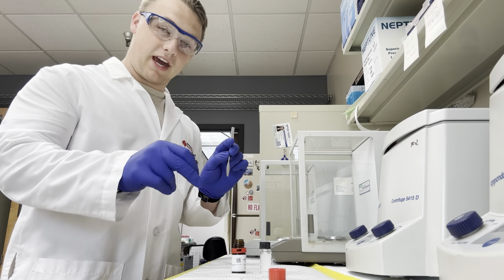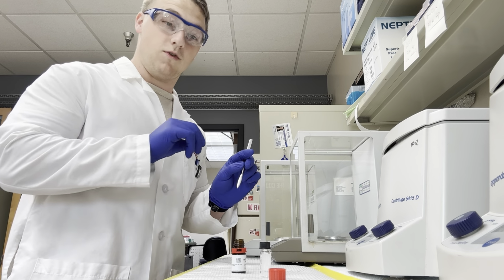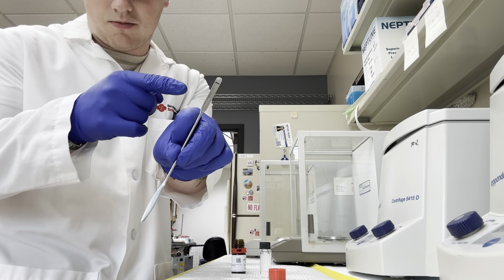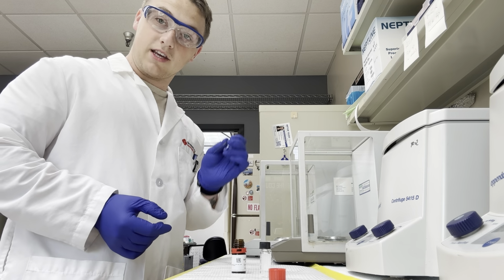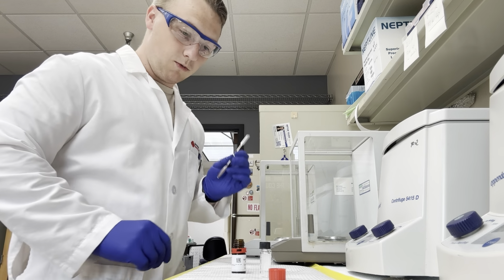Use the same side. You want to be consistent. Again, the same thing with the cap on, cap off sort of thing. Be consistent with which side of the spatula you are using. I like to go with the skinnier side here. There's also this broader side. It's more of a preference thing, but there are some bottlenecks that you just can't get into with the wider one. So I personally like the skinnier one.